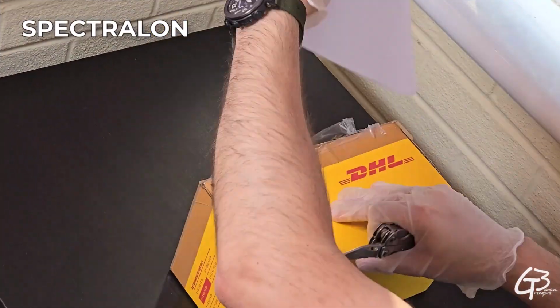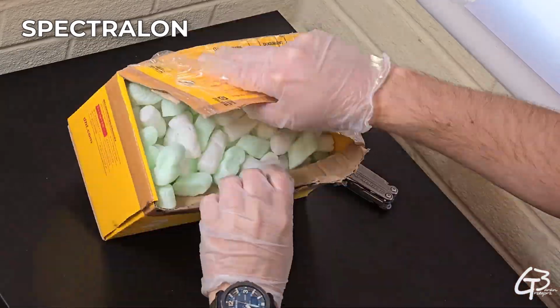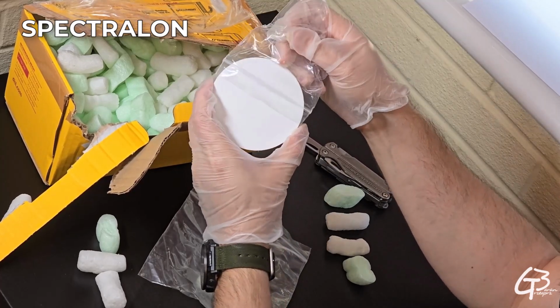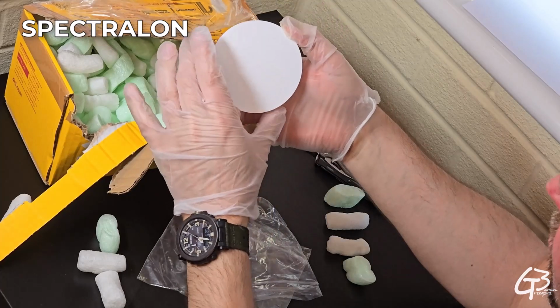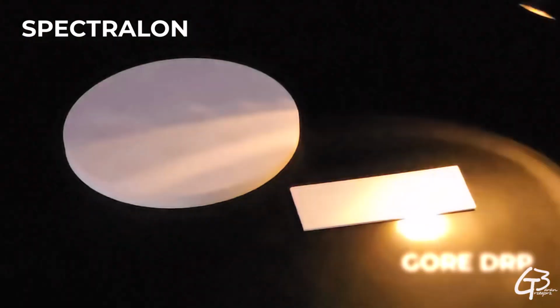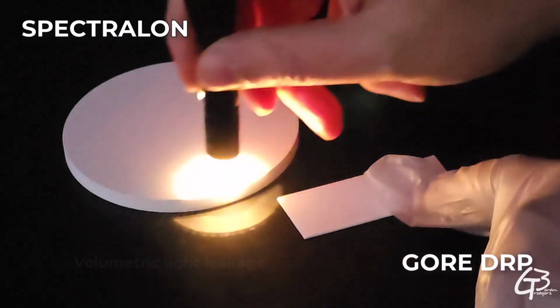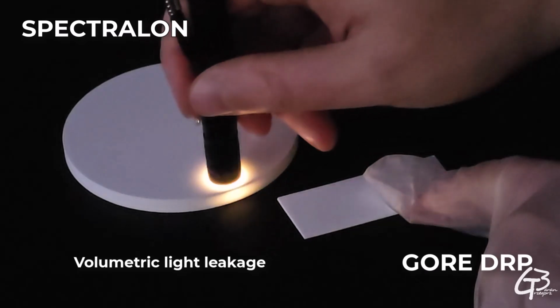Spectralon is also a fluoropolymer and in this matter is very similar to Gore DRP material, just processed differently. It's sintered PTFE, which is the highest reflectance diffuse material. Spectralon is a volume scatterer, so the more depth up to 7 mm, the higher the reflectance. Therefore, my concern when it comes to its measurement is that its result might be slightly lower, as some of the light used to sample its surface is going to leak sideways through its volume instead of getting back directly to the spectrometer sensor. We can see that if we put a torch on the sample by observing the volumetric glow on its sides. This is the light leakage which never gets back to the sensor.